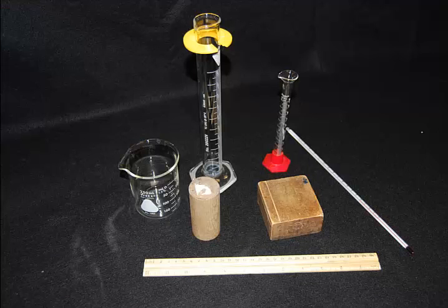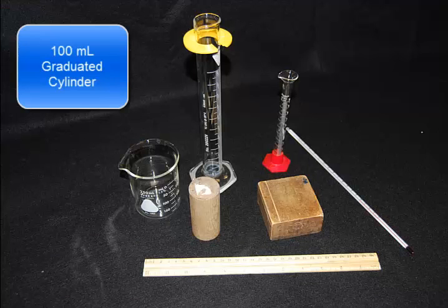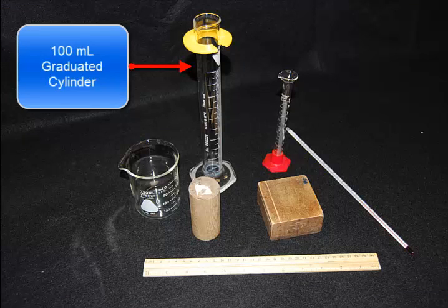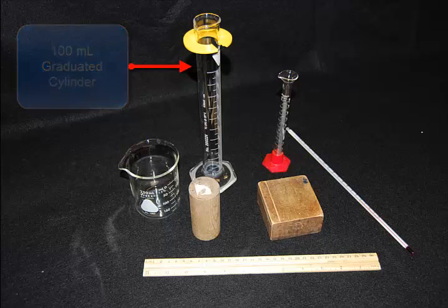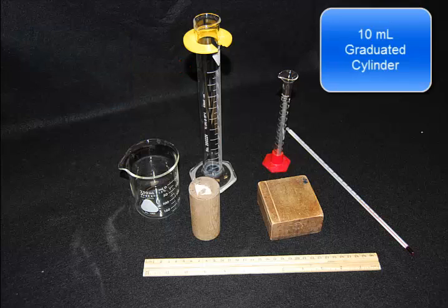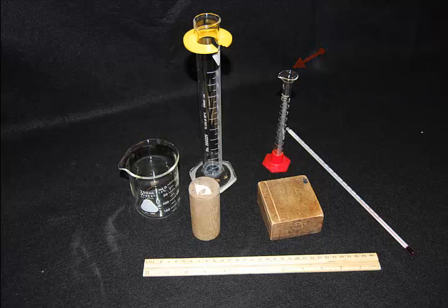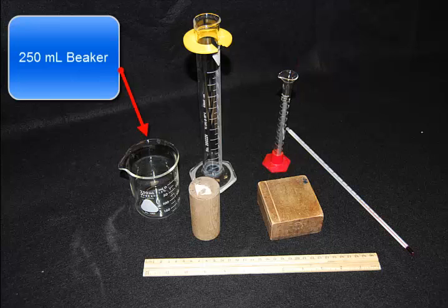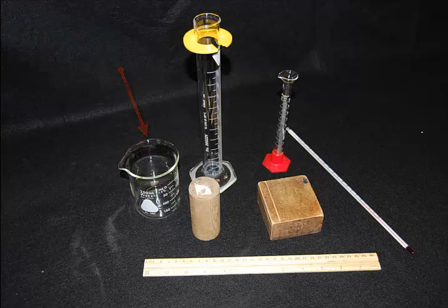The equipment you're about to use: we're starting with a 100 milliliter graduated cylinder, a 10 milliliter graduated cylinder, a 250 milliliter beaker, and a thermometer.